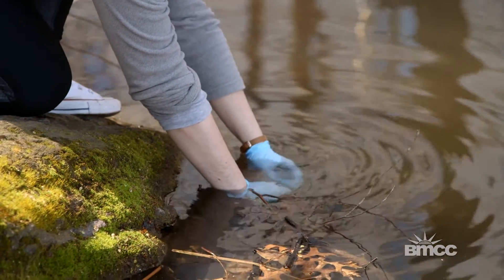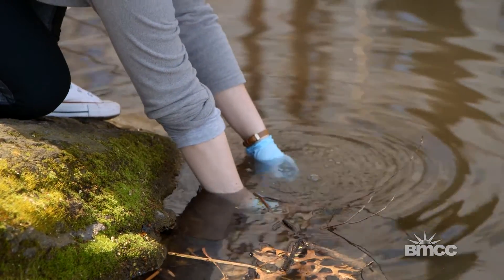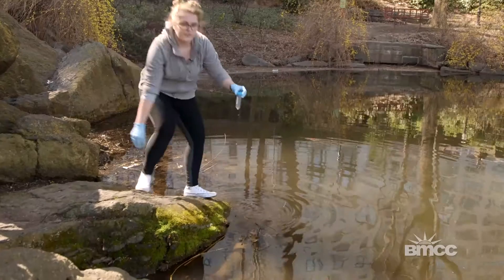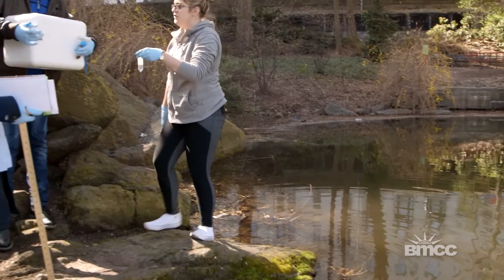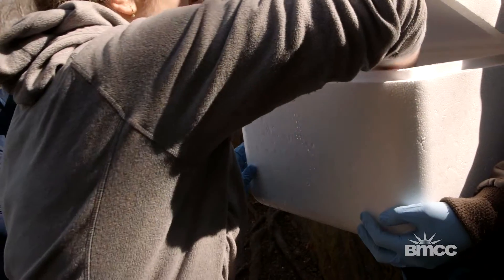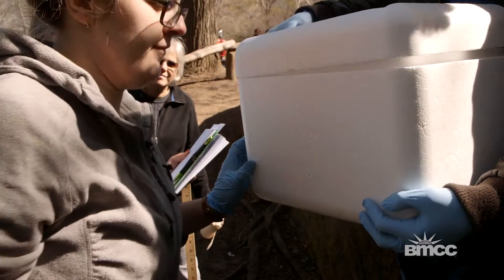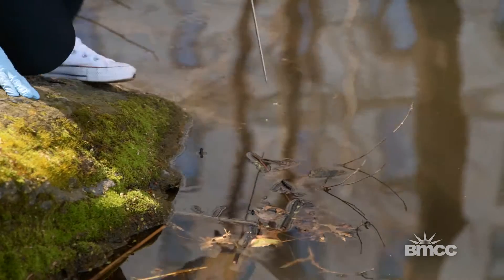They're actually doing a screen of what we find at the bacteria level and other organisms called protists. From here, we have to transfer it immediately to ice, which is going to keep it cool until we transfer it to the laboratory.